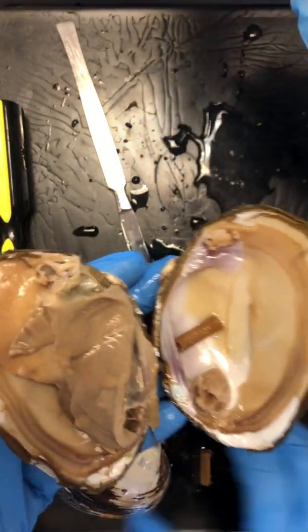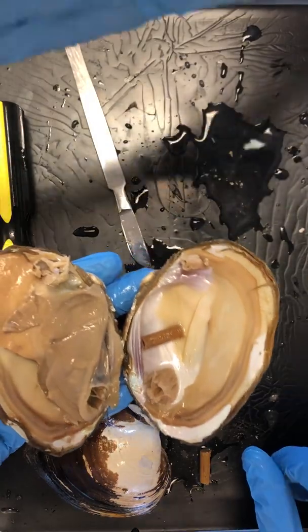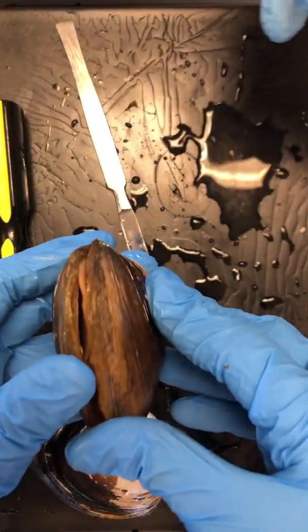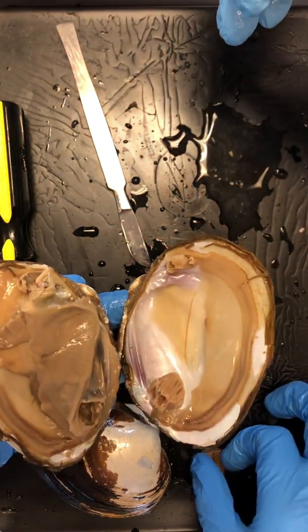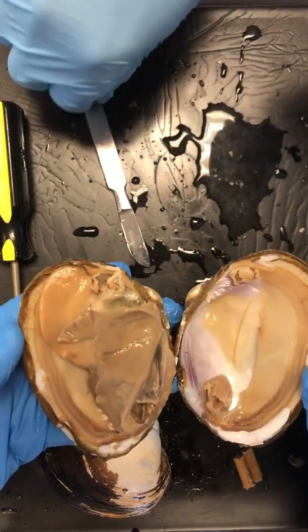Do you know that you have an adductor on your leg? What? That's the part of your leg that closes them together. Get out of here. This guy adductor. This guy closed. I wonder if all adductors keep things closed. It's incredible. What a world we live in. It's amazing. Blows my mind, actually. We're kind of like mussels. I love it.